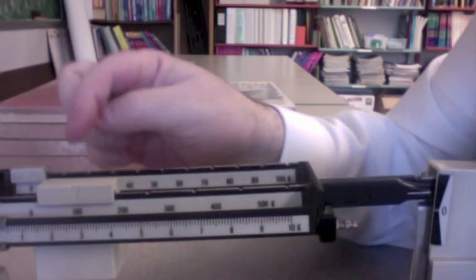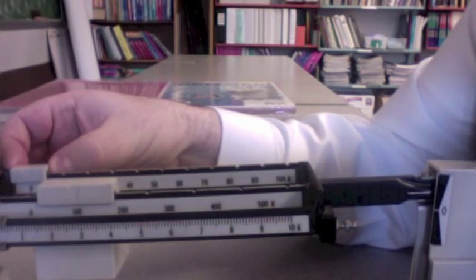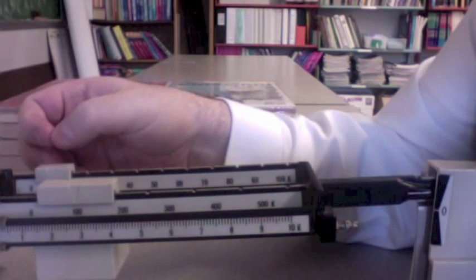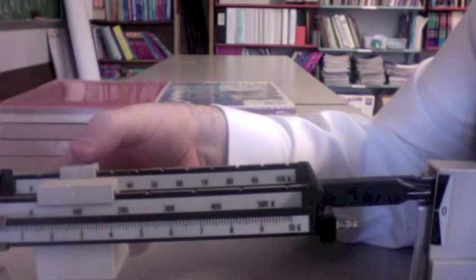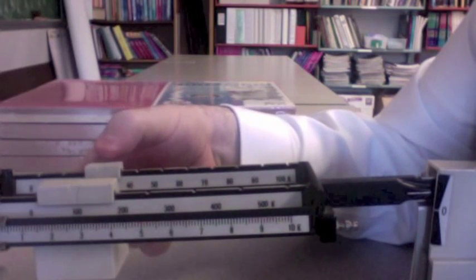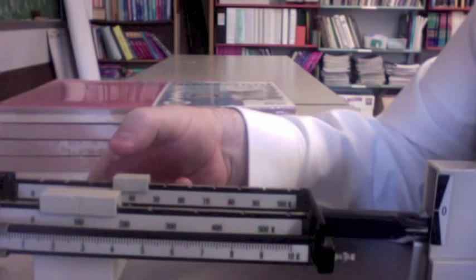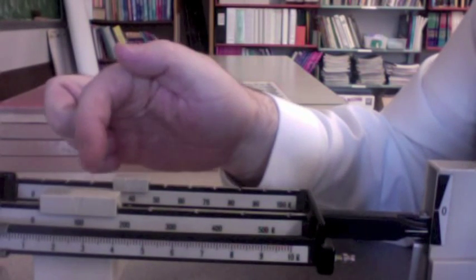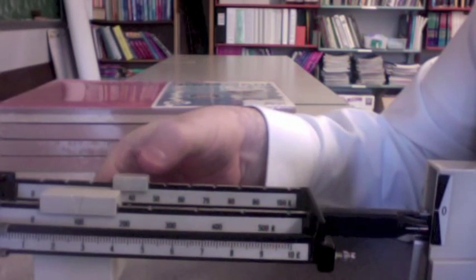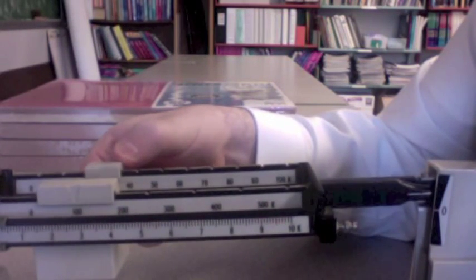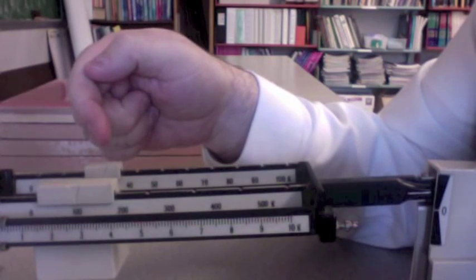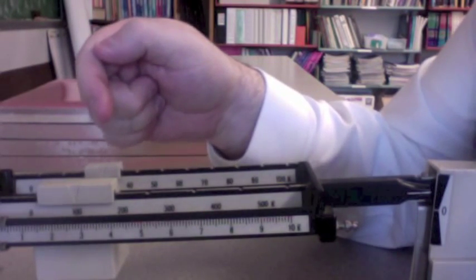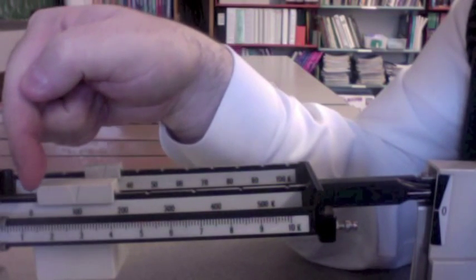So now I'm going to go to the next tens units, and I'm going to jump up to ten. Twenty. Thirty. Forty. Ooh, I have some movement. So now I know that one hundred forty grams is just too much. So I'm going to back it off to the thirty. One hundred thirty grams is not enough, but one hundred forty grams is too much. So now I'm going to move to the slider in the front.